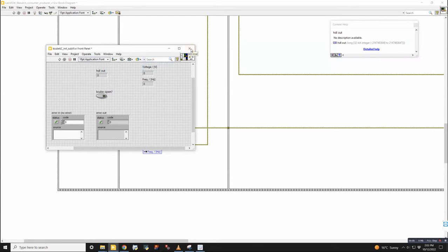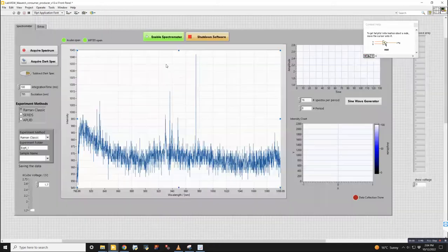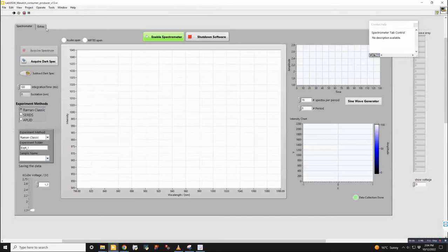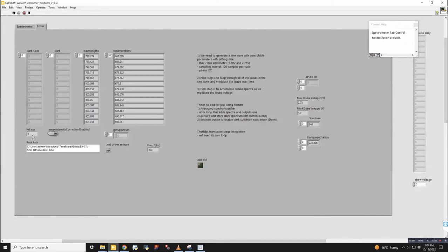So in the front diagram, we have handle out in the extras. Whenever something comes up with the instrument and with the interface that I don't know what's happening, I just go to extras and see what's the handle out here. Now it's 2, so it's going to be fine. Yeah, so you'll see if I hit run again, it'll open here, hopefully. Yeah, and now it's 3. So it continues to go up and up and up.